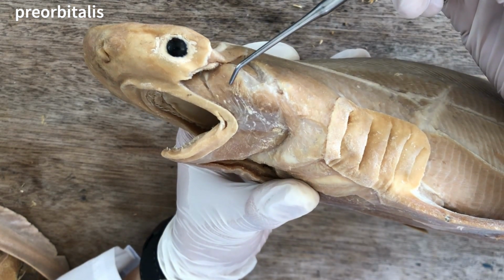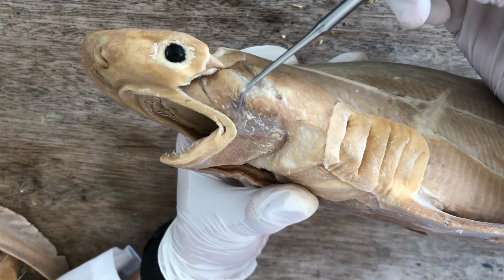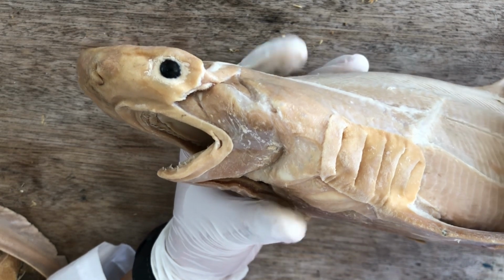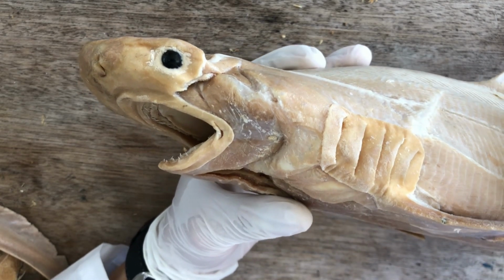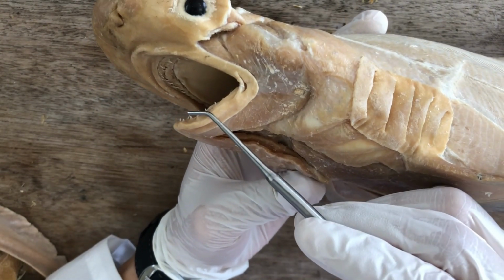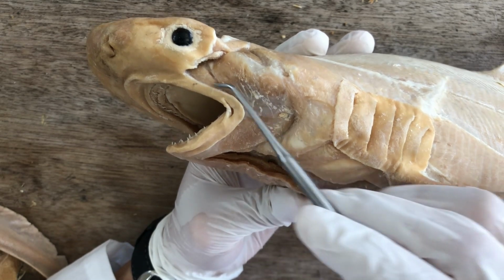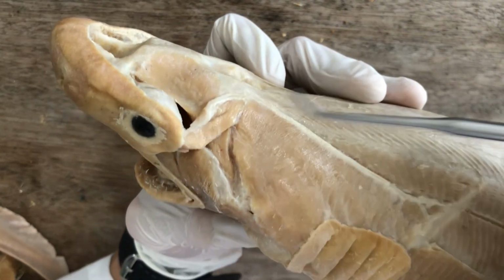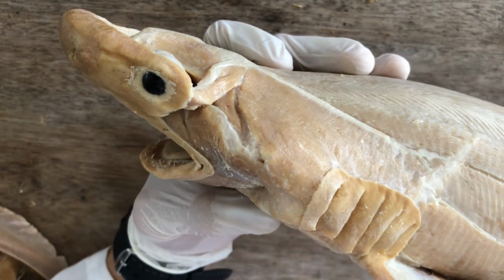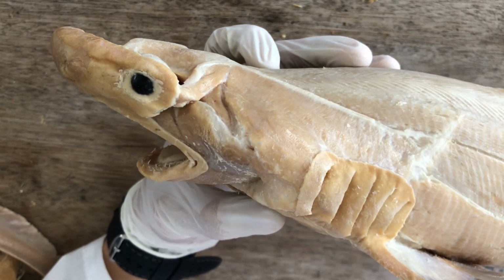Together, the preorbitalis and the quadratomandibularis form the shark's adductor mandibulae muscle. It's a very strong name. It's a strong muscle that allows the shark to close its mouth by elevating the mandible, adductor mandibulae. But together, the craniomaxillaris, quadratomandibularis, and preorbitalis are the dorsal constrictors of gill arch 1, the mandibular arch.